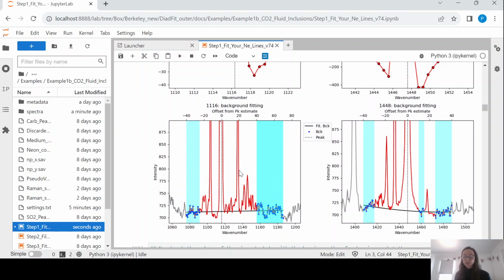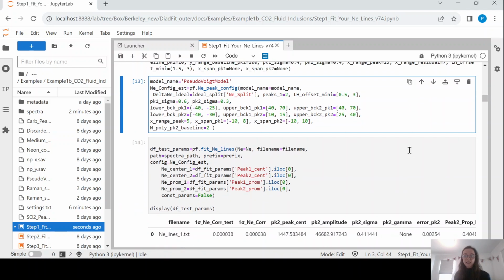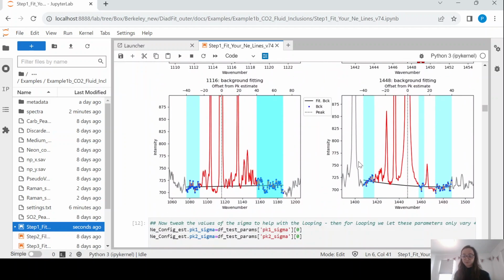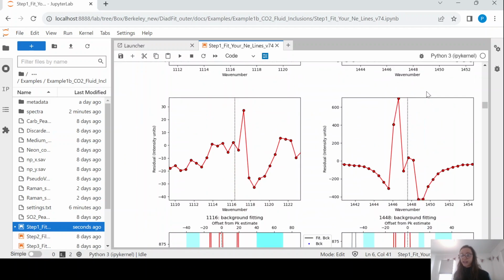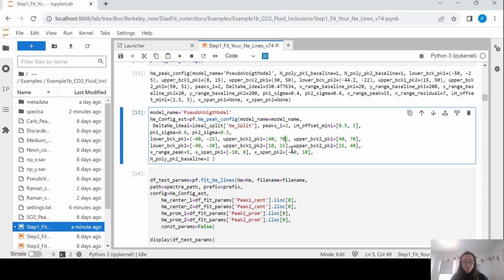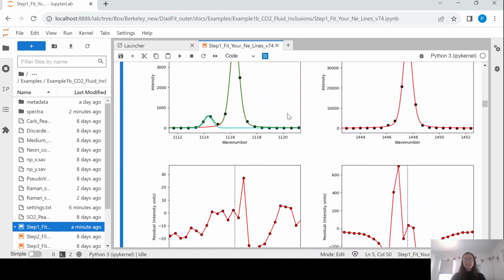So here we've chosen 2 background positions, and here we have chosen 3 background positions. So you can see that up here. So upper background, so peak 2, we're looking at the backgrounds here. We have the lower background, that's between -40 and -30 to the left. We have the upper background for peak 2, and the first one is between 10 and 15, and the second one is between 25 and 40. So you can see 10 and 15, 25 and 40. And you could set 2 different upper background positions for peak 1 as well. Here we've just set them the same. Okay, so that we are happy with that.